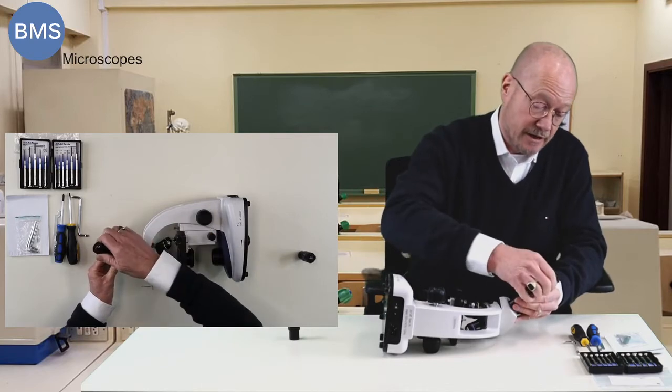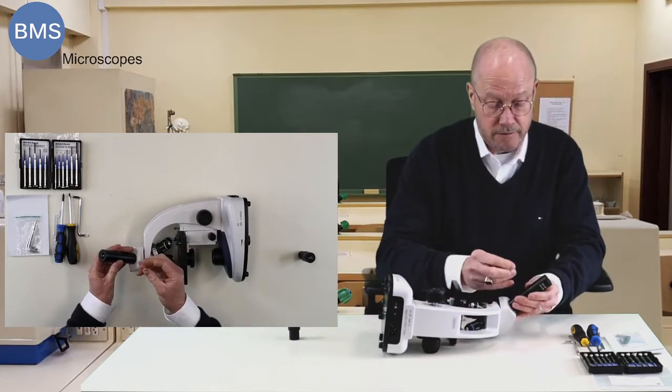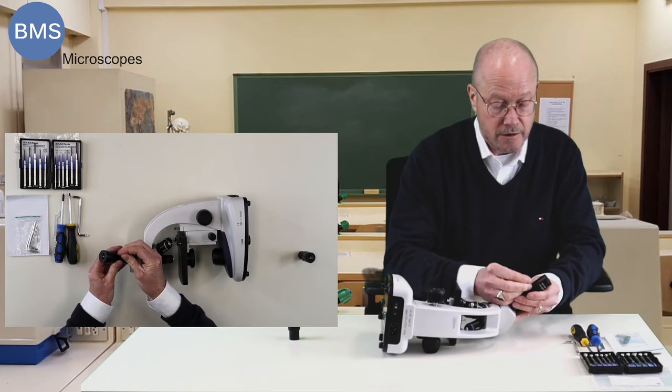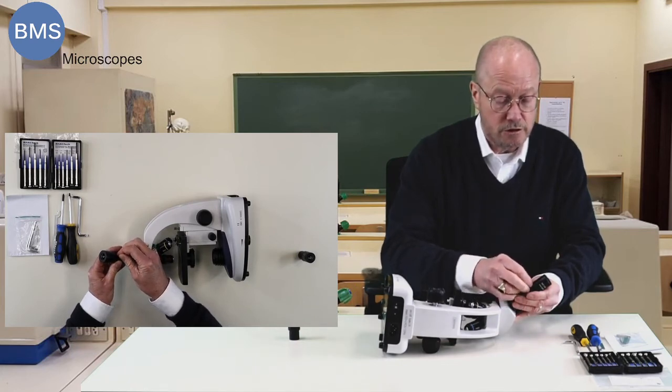Place the one in there with the built-in reticule. Secure the screw again.